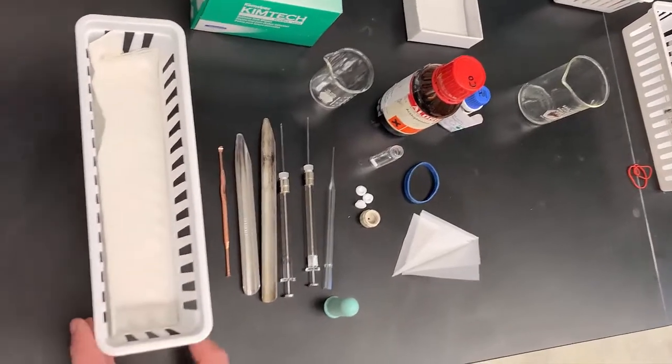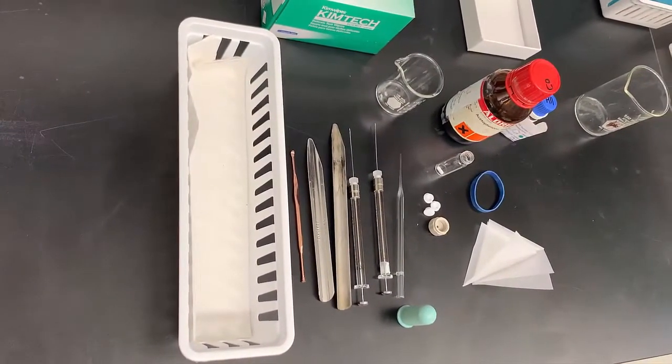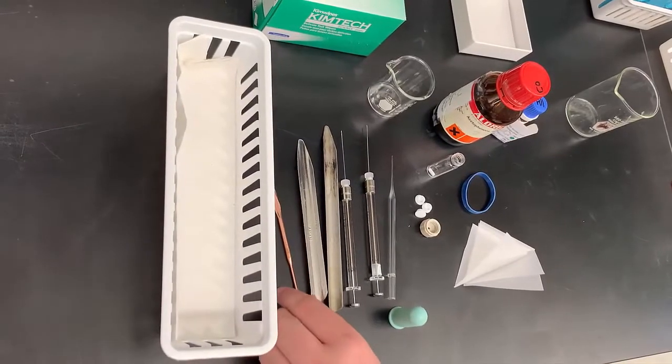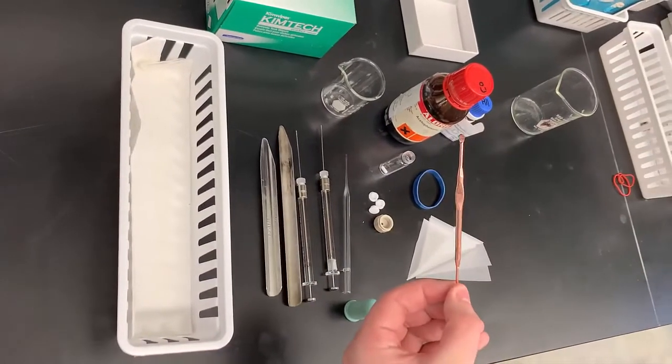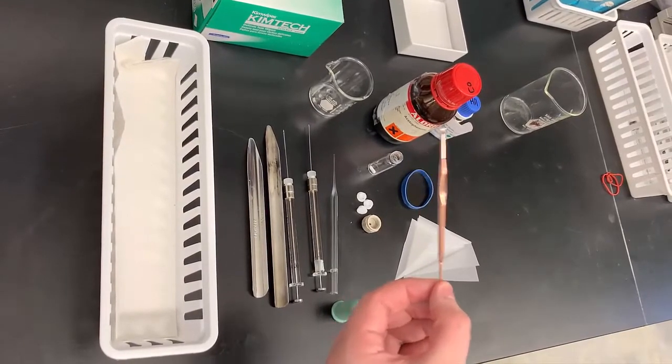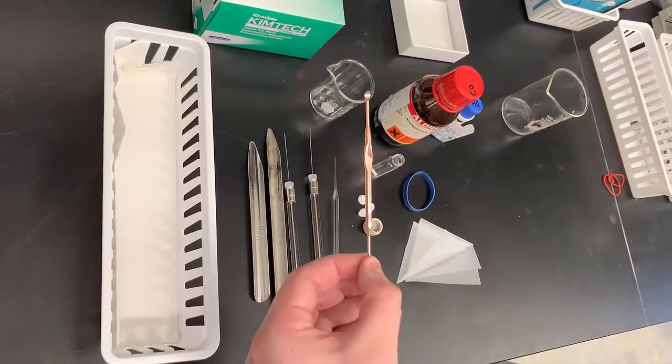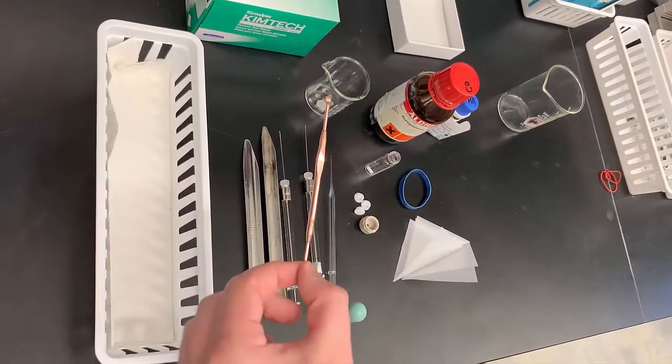First, you're going to have a basket in which everything will rest when you're entering and actually in the glove box. Very important is a rose gold spatula. This is used for our catalyst because this is a very specific amount that you can use to properly measure our catalyst in very small quantities.